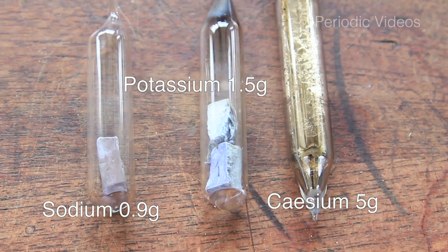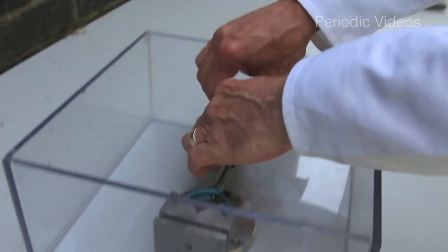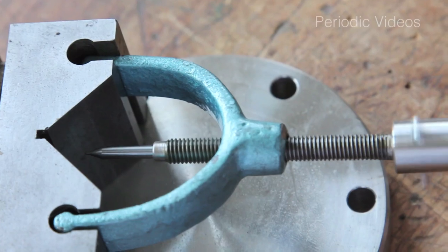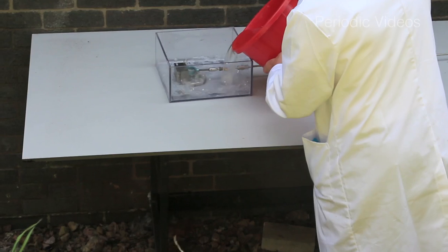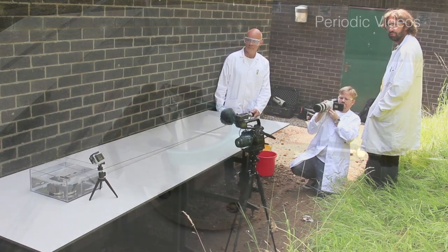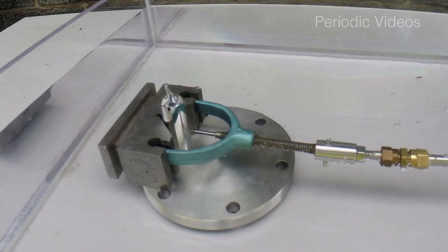Today I'm going to show you the first experiment, which was with sodium. Neil's device begins with a plastic box filled with water with flat sides, so you can video and see both under the water and what's happening on the surface. Inside is a device — a sort of thumbscrew for test tubes — whereby turning a shaft, which goes a long way away from the trough, he can force a metal pin into the side of a test tube so that it breaks. You can film the whole thing at different speeds and from different angles.